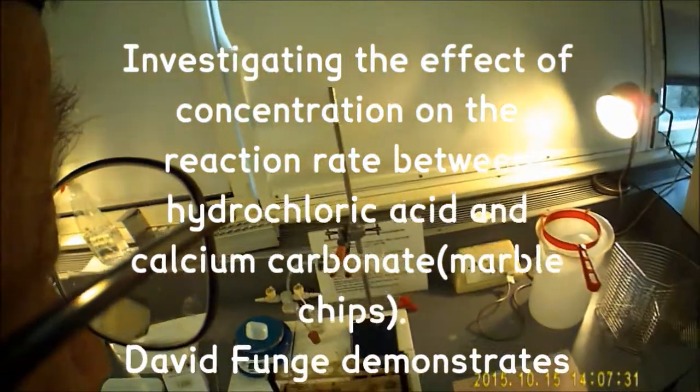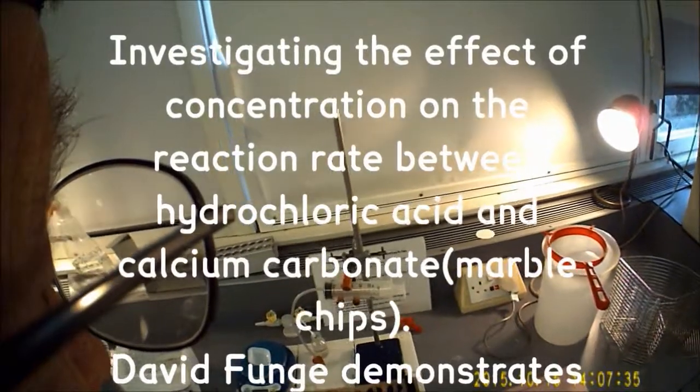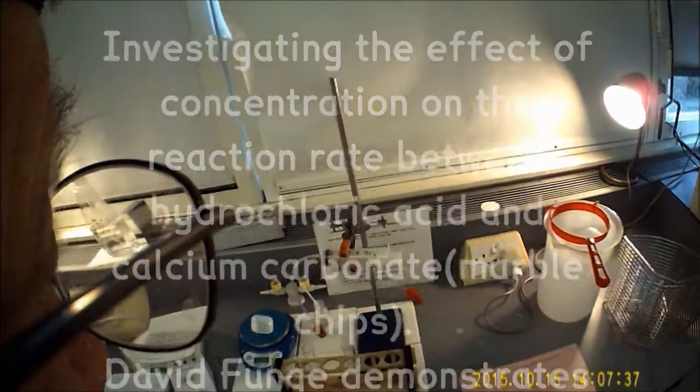I'm going to take you through today's practical investigating the rate of reaction between hydrochloric acid and marble chips.